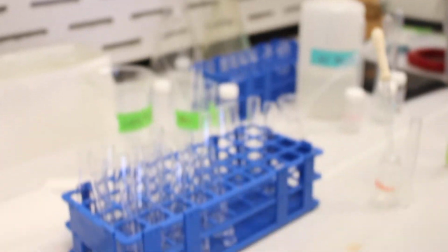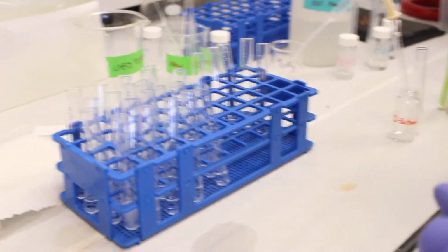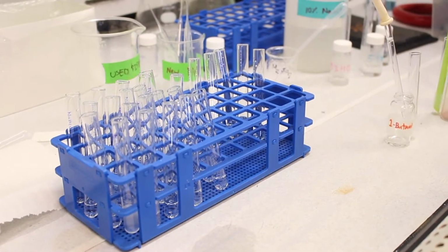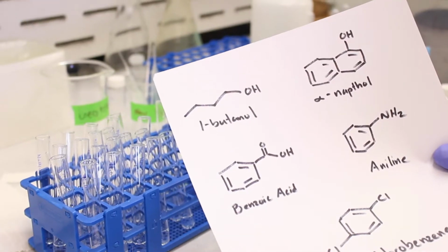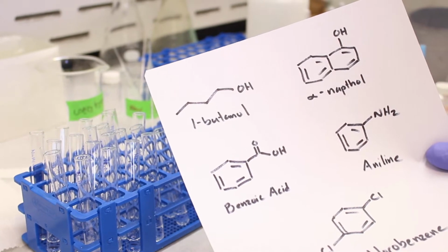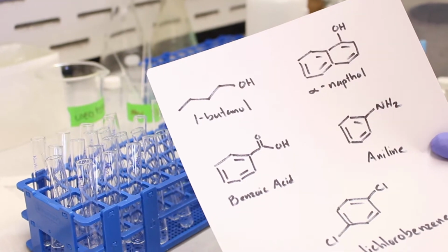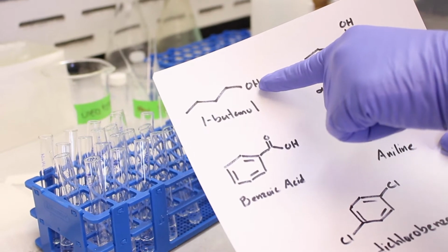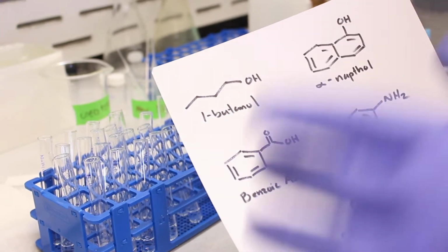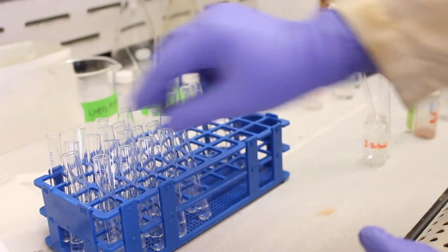So that was the control test, if you will. So that's water with no ionizing agents. The water is neither acidic nor basic. If you look at the butanol structure, the functional group is an alcohol. It's an OH group. Now, the OH group can be ionized, but it doesn't ionize very well unless you have an extremely powerful base, such as sodium hydride or LDA, something like that. But if you're going to use something like sodium hydroxide to try to deprotonate it, that's not going to work very well because the equilibrium is about the same. So with 1-butanol, we would expect it to be insoluble in bases as well as acids. So OH is pretty inert.